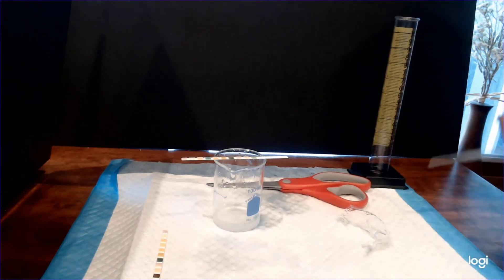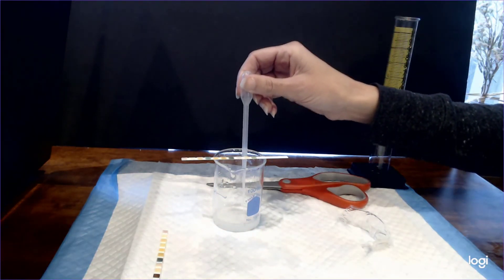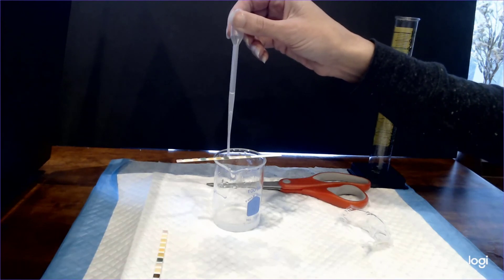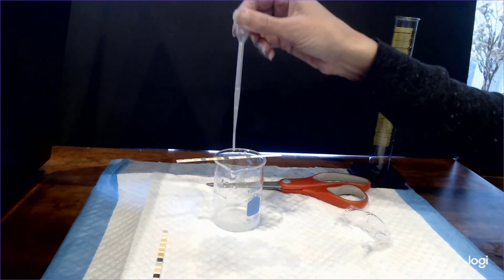So I covered all of the pads but you could have also done something like this where you just kind of threw the solution on top of the multi sticks.